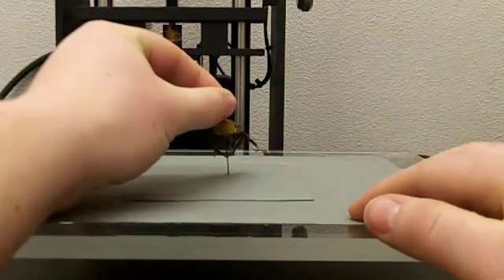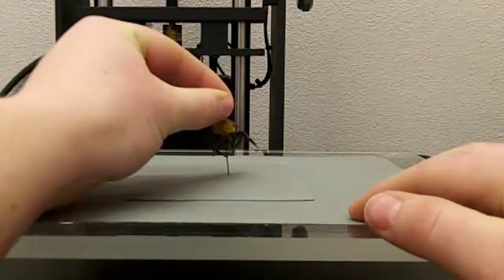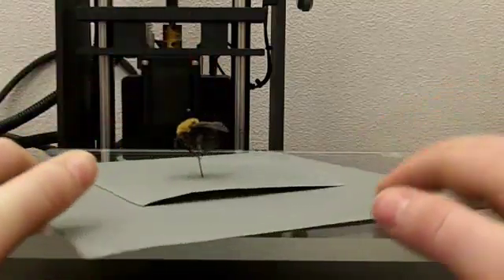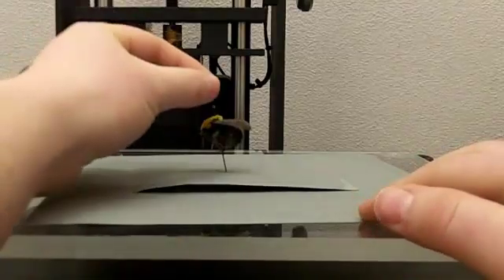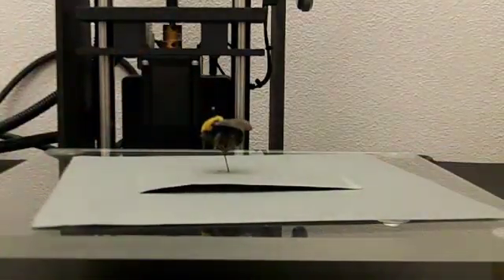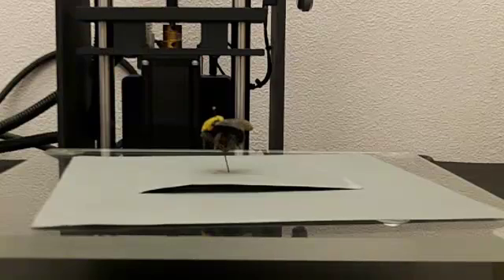The thing to remember is you want to go by how the specimen looks and not by how the pin looks. So now, our specimen is ready for a dorsal shot to be taken.